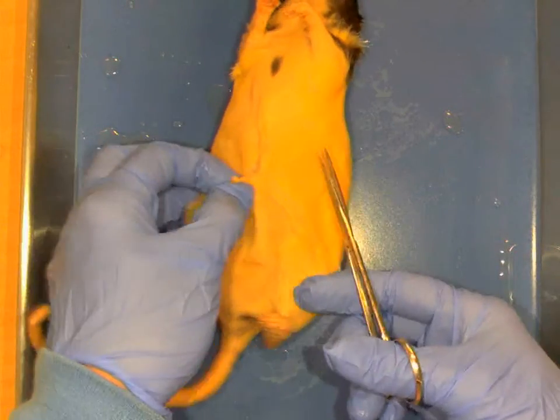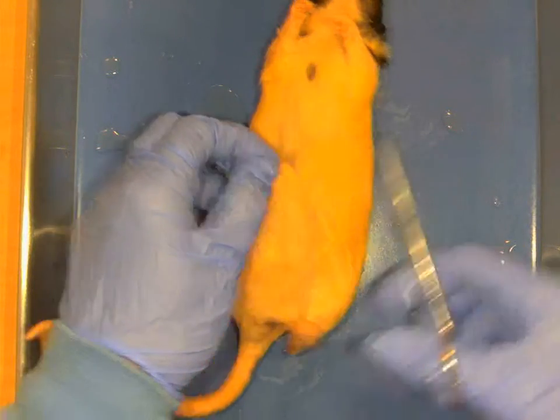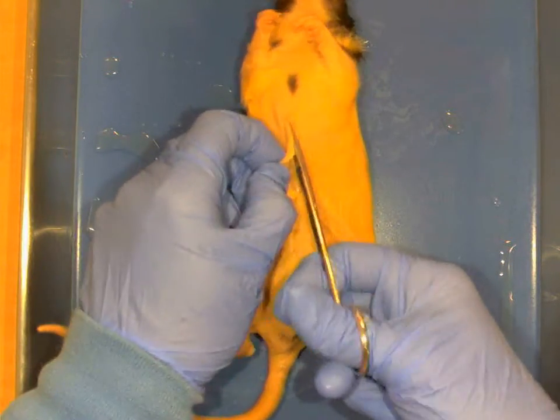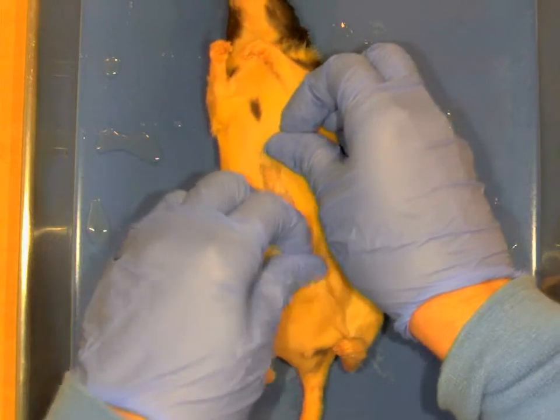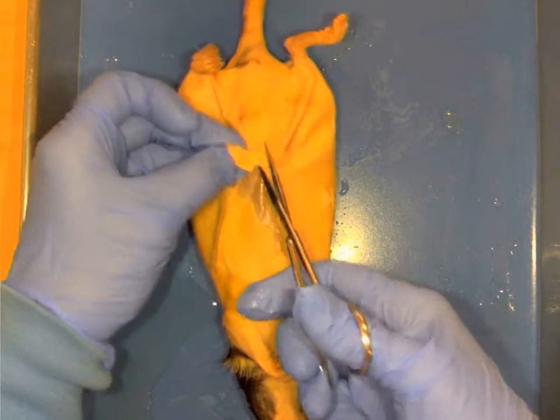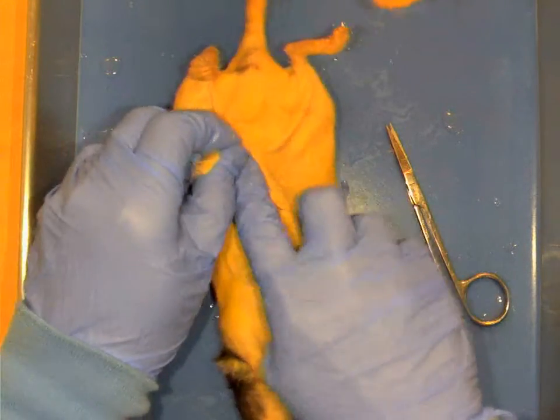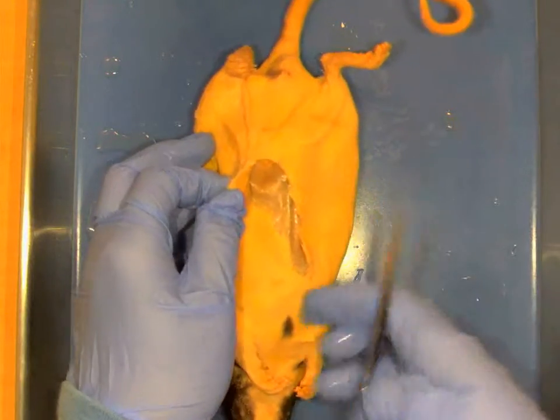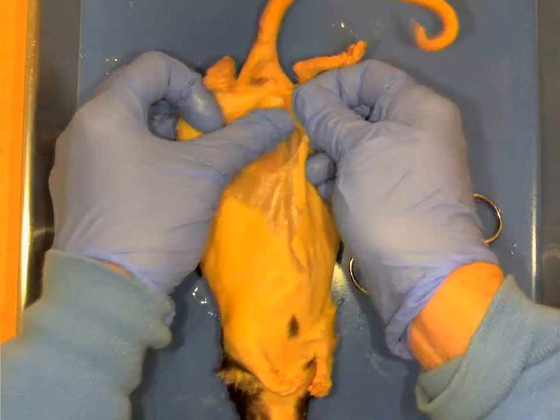Notice how I pulled up on that, and so now see, I'm just under the skin, and what I want to do is just cut through the skin and not into the muscle, so I can see some of my major muscle groups. So what I'm basically going to do is just kind of turn it around this way, get up under the skin, between the skin and the muscle, and I'm going to make a mid-sagittal cut. You should know what a mid-sagittal cut is from having the first A&P1 anatomical terms lab. So here I go. I'm going to make a mid-sagittal cut. I'm just separating the skin from the muscle underneath.